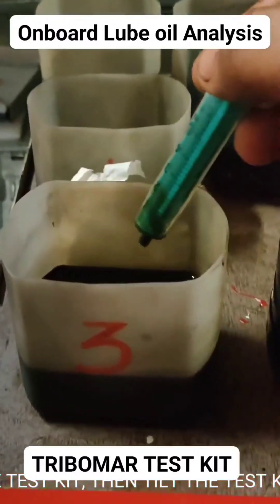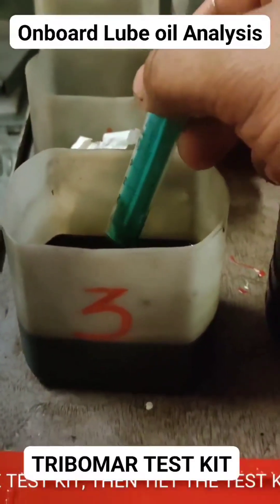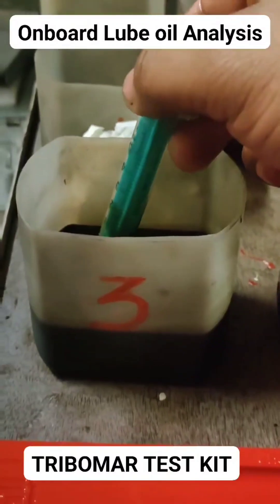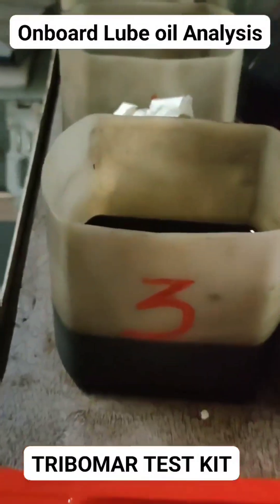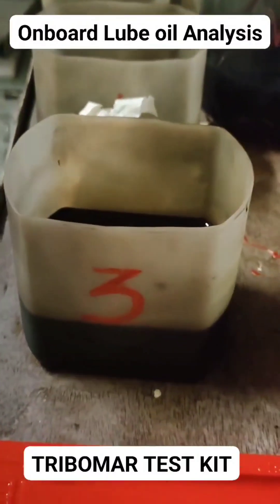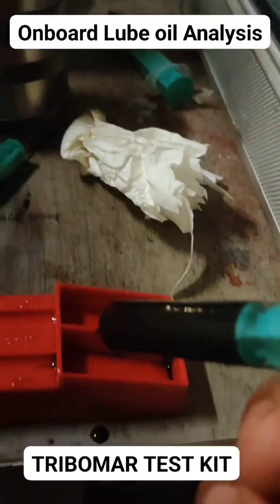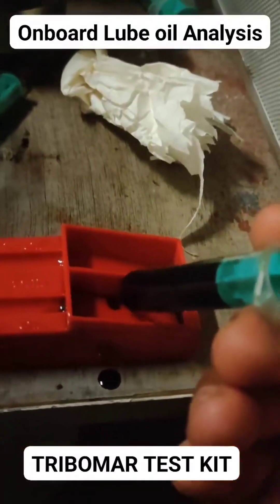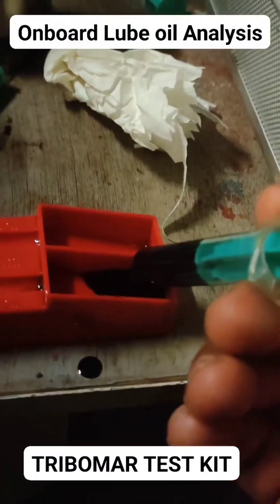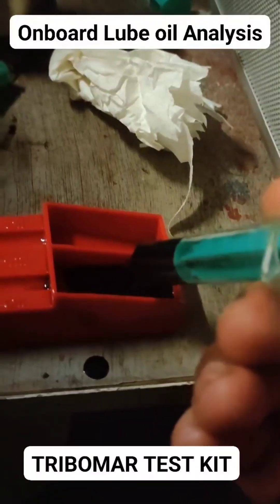Next will be the viscosity test. Prepare five milliliters of used oil sample and five milliliters of new oil sample, then put each on the designated place in the test kit. Tilt the test kit so that the samples flow down the line, then record the result when either sample reaches the center of the OK result.